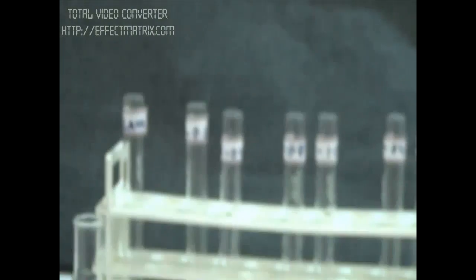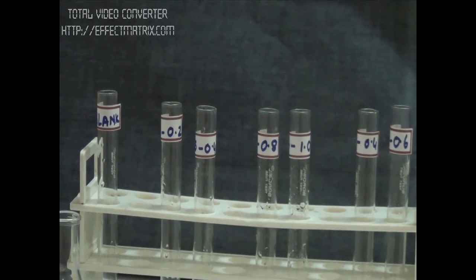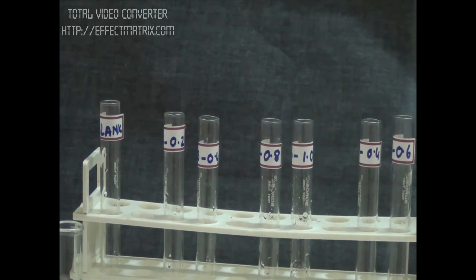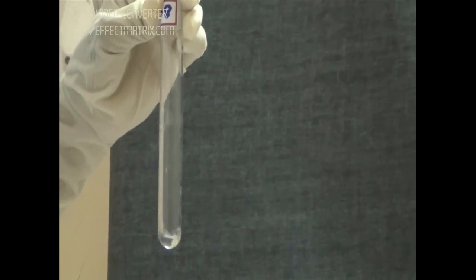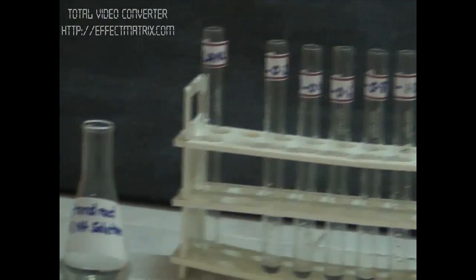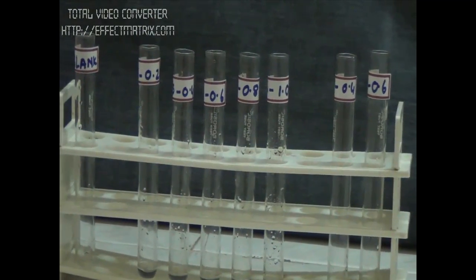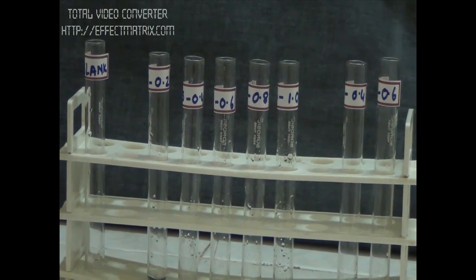Then I am having 0.4 ml in my pipette and I also need 0.4 only. So I will add 0.4 in the third aliquot. Now in the fourth aliquot, we will take 0.2 ml of distilled water. And in the fifth one, we had 1 ml of solution, so we don't need to add any distilled water.